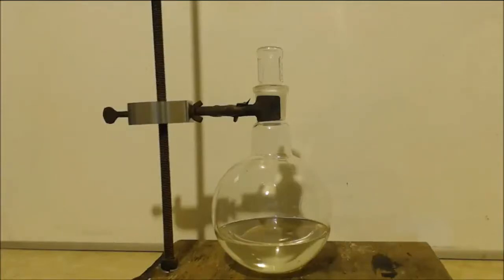Most people that distill it know when you get that foam, they keep distilling and distilling until it almost jumps over through the condenser. I mean, as soon as I see it inching up, that's it, I'm done. So I probably could have got more. This is crystal clear, but I don't know, you can see it on film. It's got a yellow tint to it. That's why I put the white background.